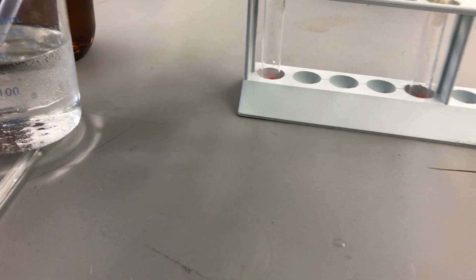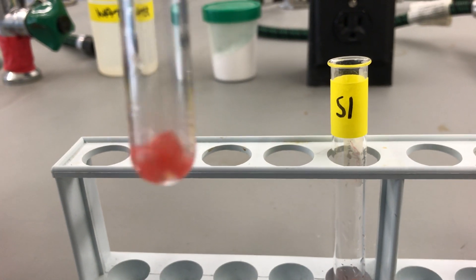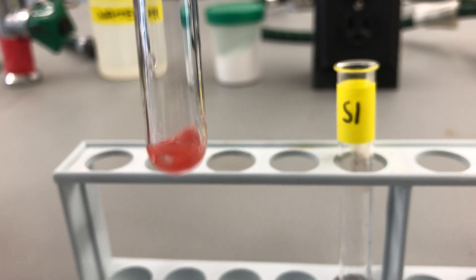Now, if you look in the bottom of our test tubes, we can see we have a little bit of our solvent in there with our lipstick. You can see it's starting to dissolve some already.